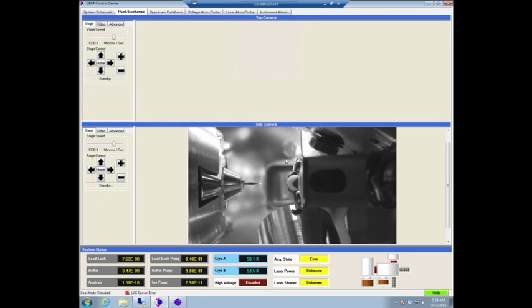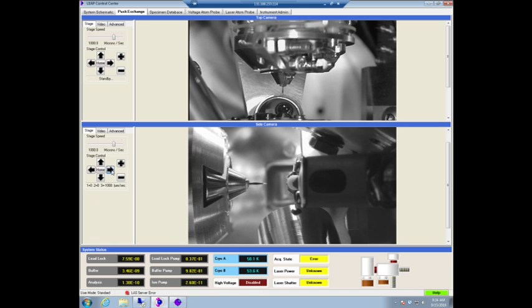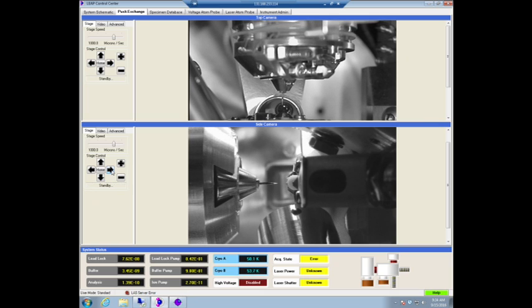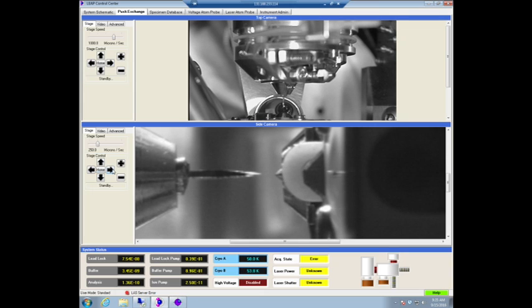Okay, so the next thing, of course, is we do the coarse alignment. So we move the sample in, which we'll do slowly and carefully because there's a little bit of lag caused by the remote connection. Again, if you're working on the machine, you're not going to have to deal with that. You're going to see what's happening live. And if you start to skip, you risk damaging things. And with the scroll wheel on the mouse, you can zoom in and out. When you zoom in and out, it actually automatically adjusts the stage speed along.